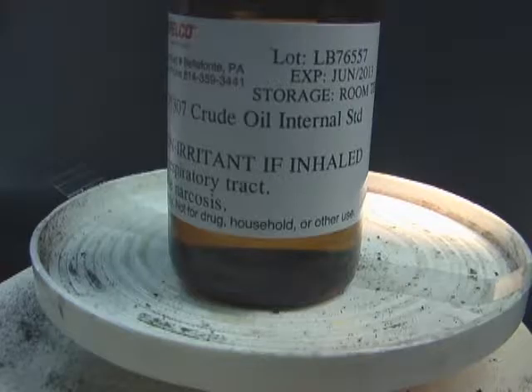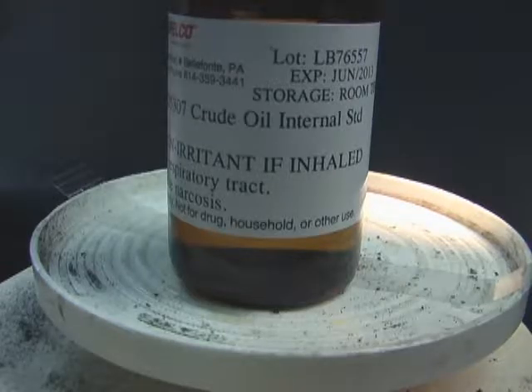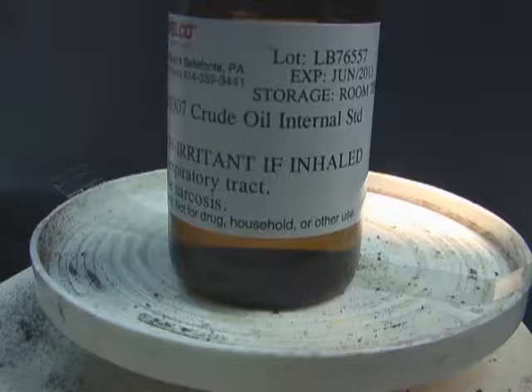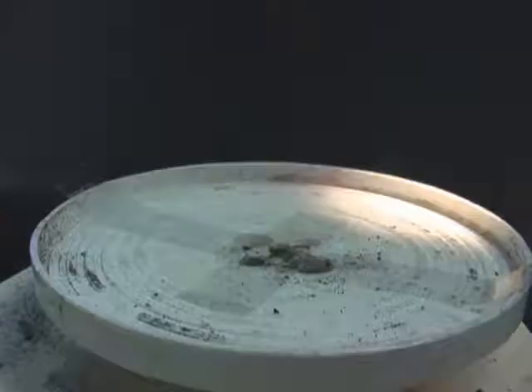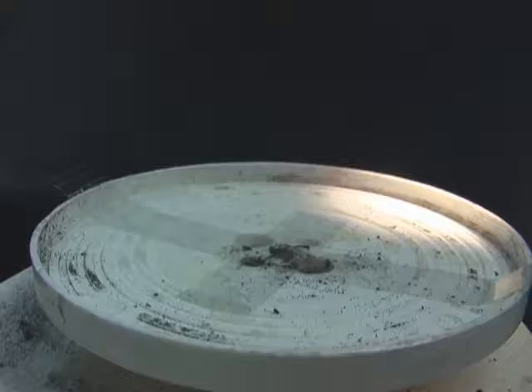In this demonstration, we will use crude oil internal standard. Because internal standard crude oil is transparent, to make it visible, we have added red dye.